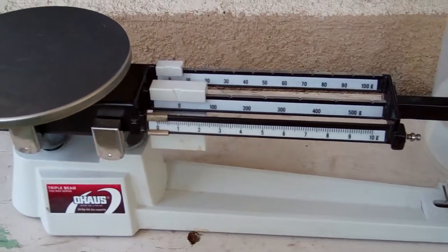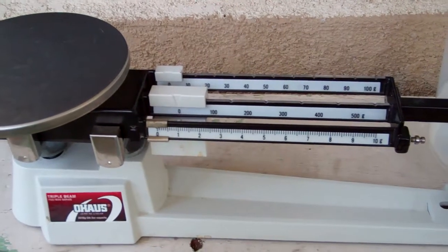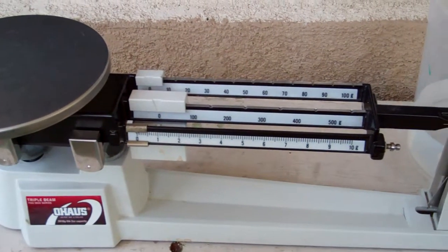The triple beam balance. If you want to record the mass of an object, you've got to use a triple beam balance.